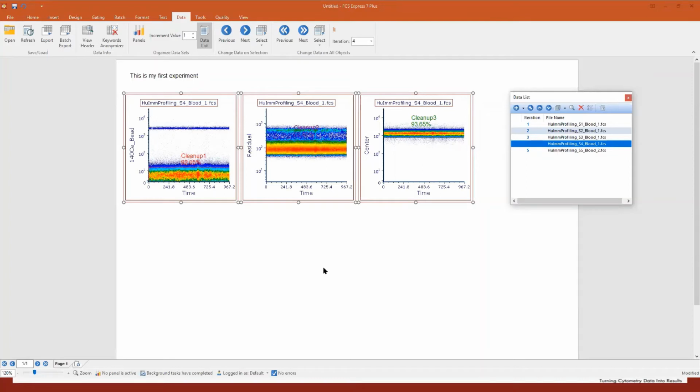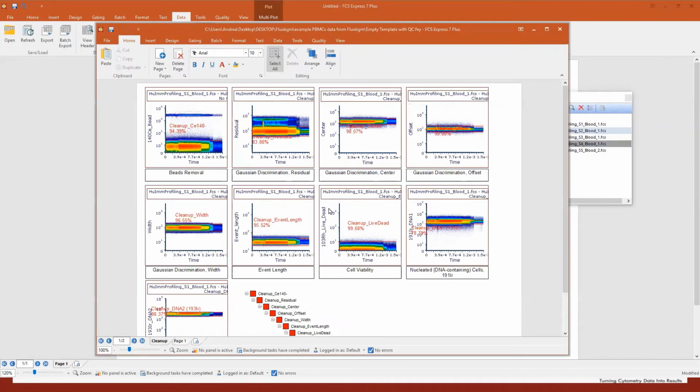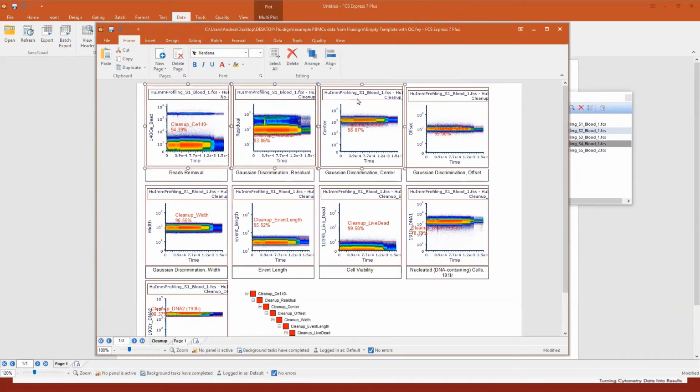And of course, you can adjust gates sample by sample. You can make gates consistent among all samples. It's up to you. You have all that flexibility. But the main point is that you don't need to create multiple pages, multiple plots, multiple gates if you're dealing with multiple files. This is really time saving. I'm not going to create the full cleaning up hierarchy you see here. So far we created plots number 1, 2, and 3, but it's just a matter of dragging and dropping, changing the y-axis and so on. So it's really easy to handle.